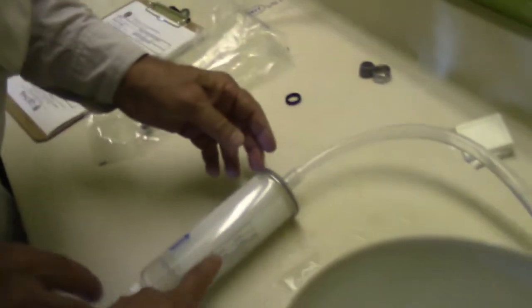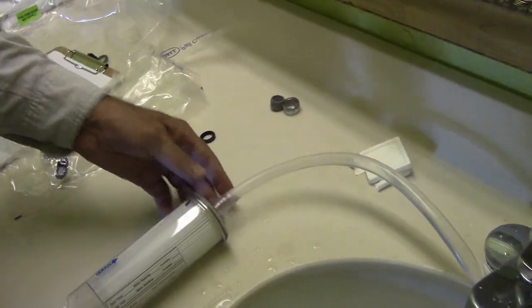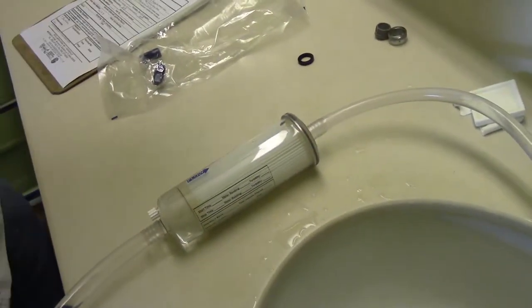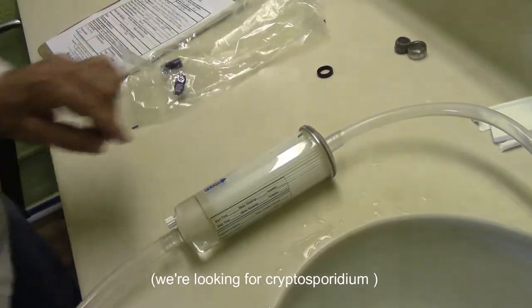This filter here, this is what's being tested, this is what will be sent to the lab? Correct. Okay, so we're going to capture, if it's there, the little parasites on this filter. Oh, interesting.